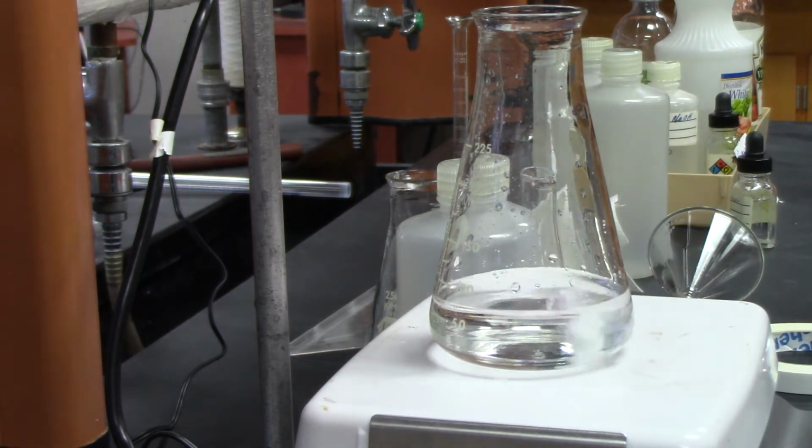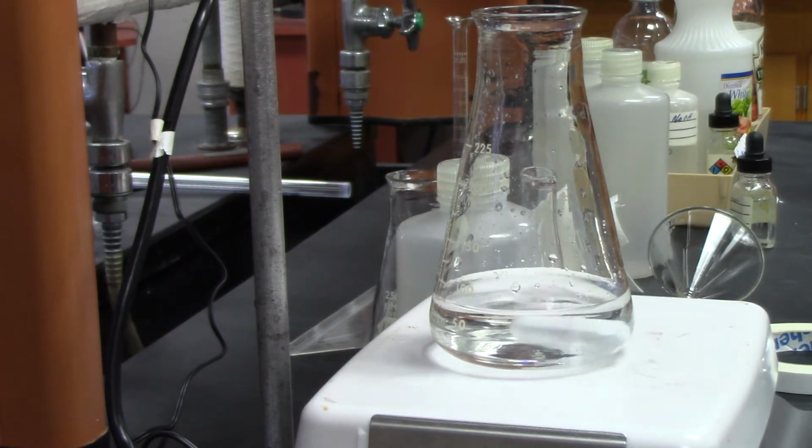But don't go past 50 because it doesn't measure after 50. Hopefully it won't do that, okay? The amounts are supposed to work, so we don't get that. So we've got about 15 more mils before it gets there.